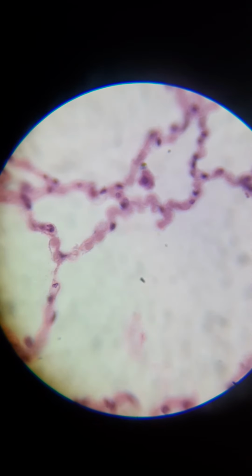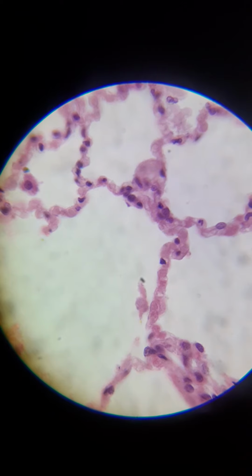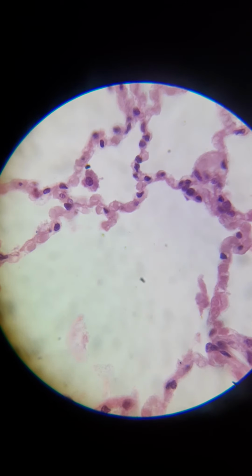All right. So let's go over here a bit in one of these alveolar walls. Again, the light segments is where the air is, and the walls is where the gas exchange is happening. So all of the dark stained dots there are type 1 alveolar cells. They just make up the structure of it.